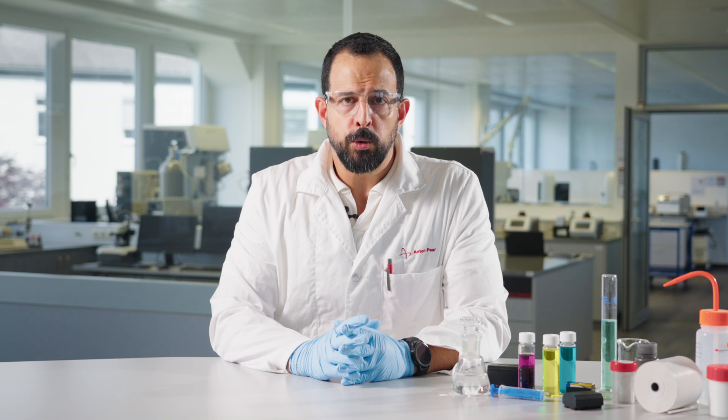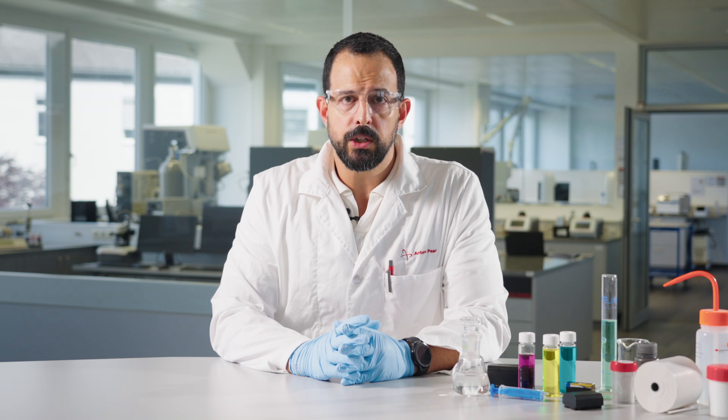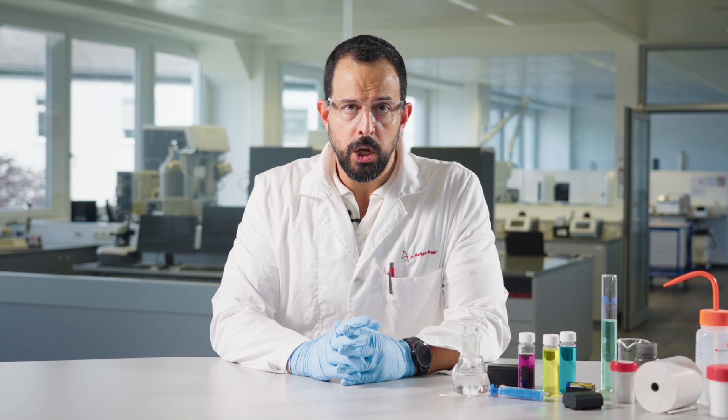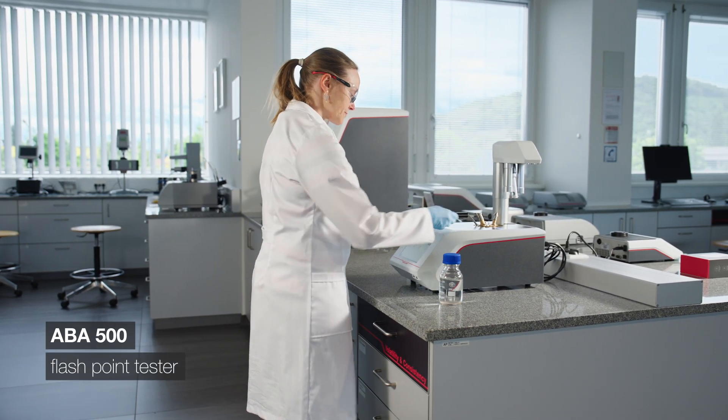Lastly, we will look at the flashpoint of electrolyte solutions. For the safety evaluation of a battery, the flammability of electrolyte solutions should be considered because of the flammable solutions used for electrolyte formulation. It is worth mentioning that the addition of electrolyte salts to the solvents used does not change the flashpoint significantly, which means it can be approximated that the flashpoint of the solvent or solvent mixtures without electrolyte salt lies within the experimental uncertainties.